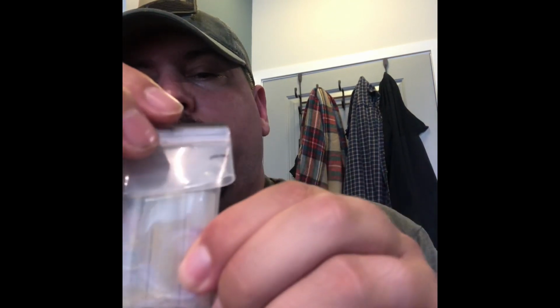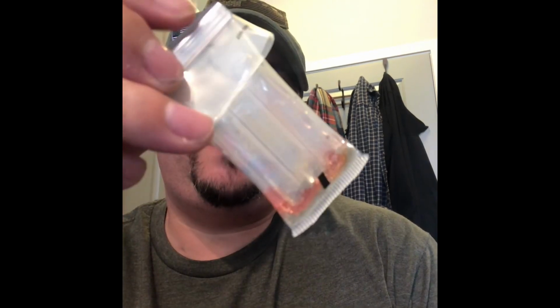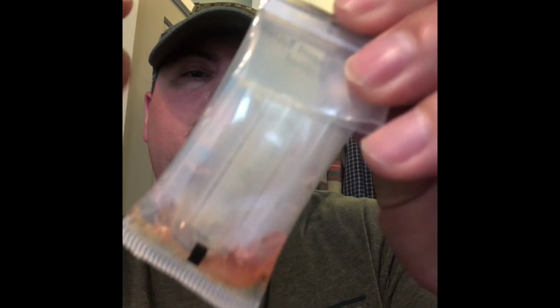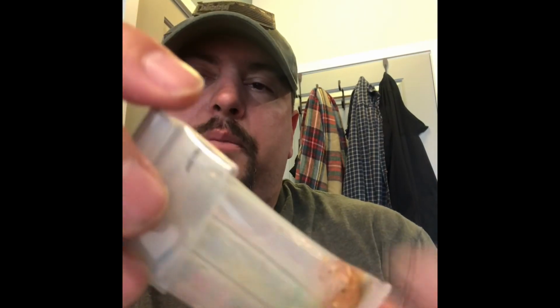And again, with cocaine, it's got to turn blue, pink, or a bluish pinkish color. Left to right, pink first. It's pink, right? It's pink because it was pink to begin with. Now, let's break the second. About 30 seconds. And now it's blue. Look at a tiny little blue tint. Tiny, tiny. We still got to break the third though.